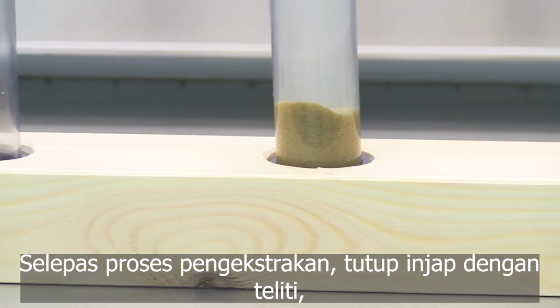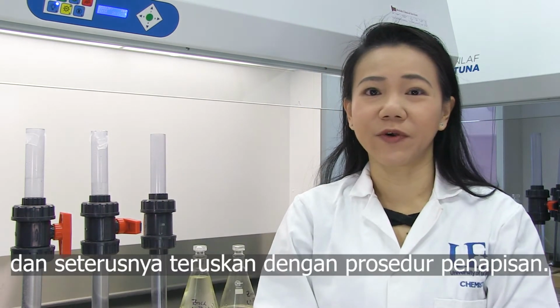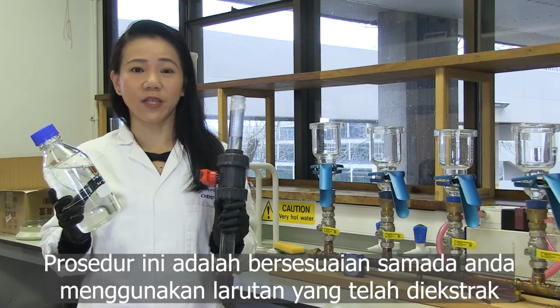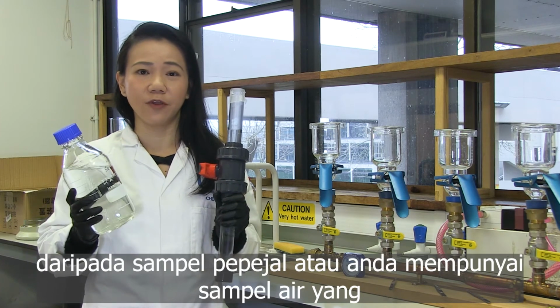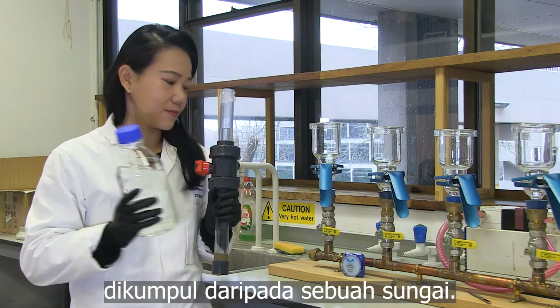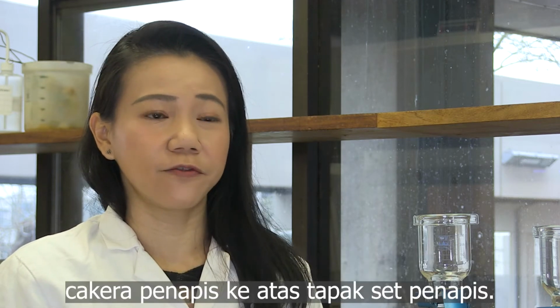After the extraction process, close the valve carefully and then proceed to filtration procedures. Whether you are dealing with the solutions you have extracted from your solid sample or you have a water sample that you have collected from the river, these are the procedures for both of those samples. To start the filtration procedures, you need to place the filter disc on the support of the filtration set.